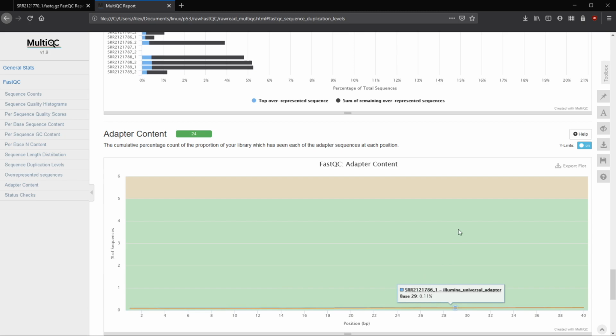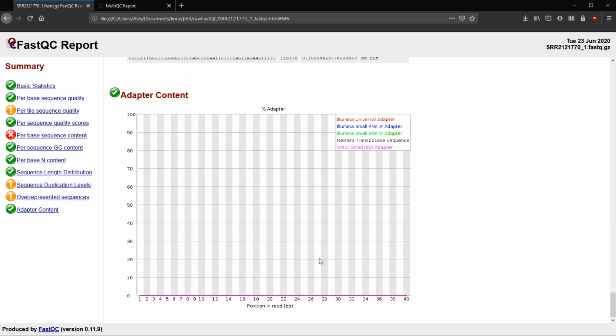So in extreme cases, at the beginning, it'll start off probably relatively small, and as it gets closer to the end of the sequence, it'll increase, kind of like maybe a really slight S-curve. So that is kind of explaining the adapter content. A warning will happen with the adapter content if it is found that more than 5% of the reads have adapter sequences in them, and a failure will happen if adapters are found in more than 10% of the reads. So a warning is about here, and then it would fail if 10% of the reads had some kind of adapter content to them.